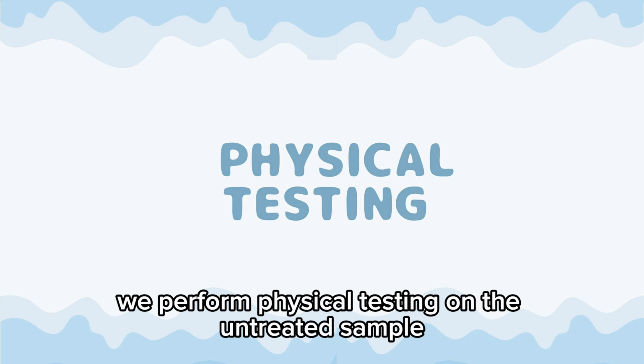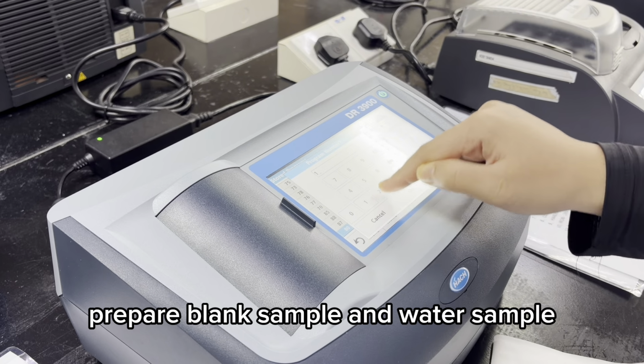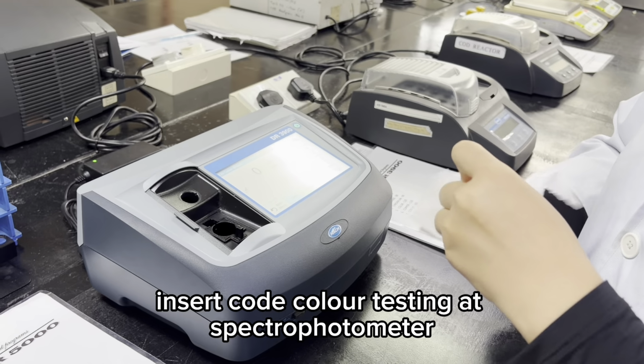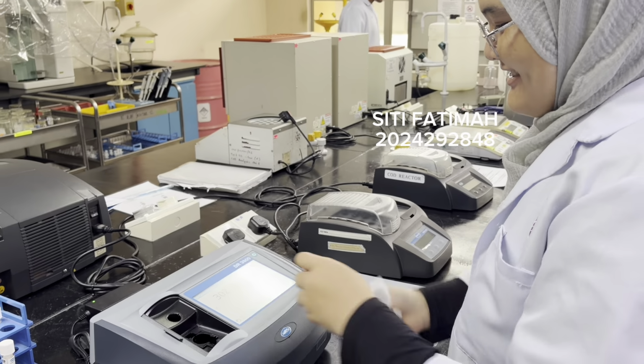First, we perform physical testing on the untreated sample. We prepare a blank sample and a water sample, and insert them for color testing at the spectrophotometer. We wipe the sample cell and take the readings.